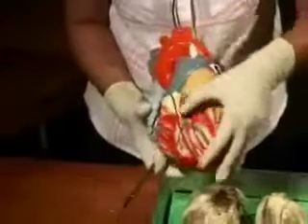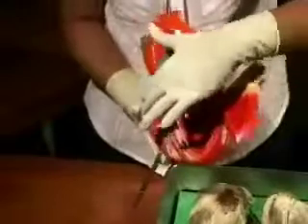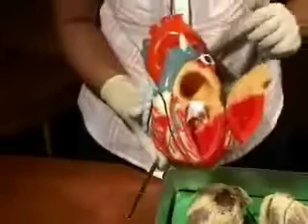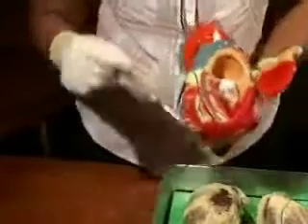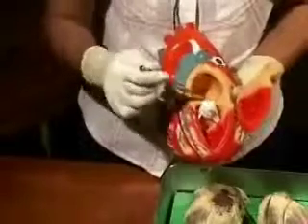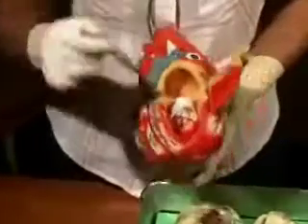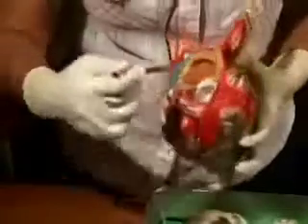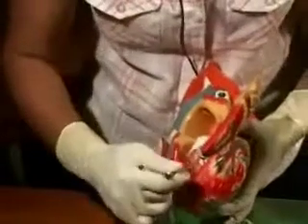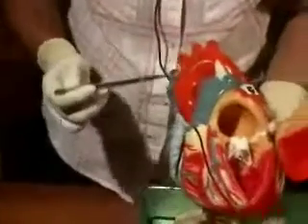Then let's look at the left ventricle and left atrium together. So this is the left ventricle, much thicker wall, the interventricular septum separating it from the right ventricle. This is the bicuspid or mitral valve which makes the left atrium communicate with the left ventricle. And then here we have, you can't see the opening, but about here, a little posteriorly, is where the left ventricle sends its blood out through the aortic opening into the aorta.